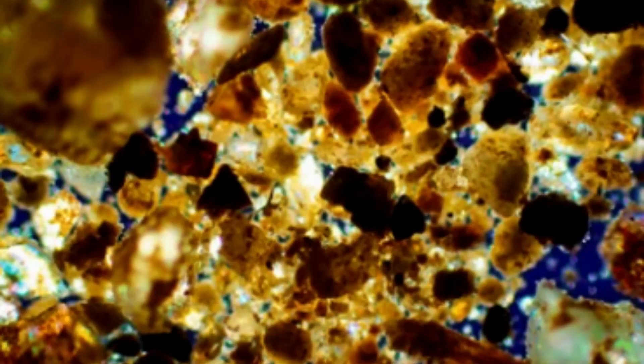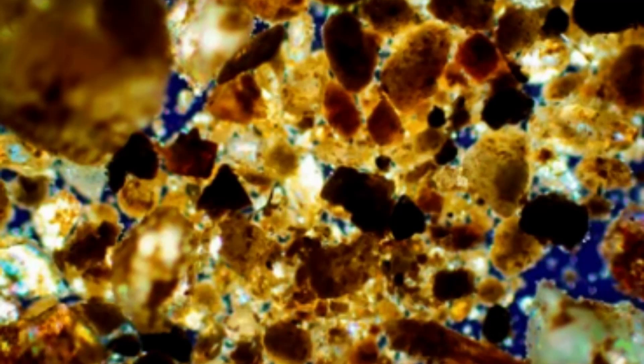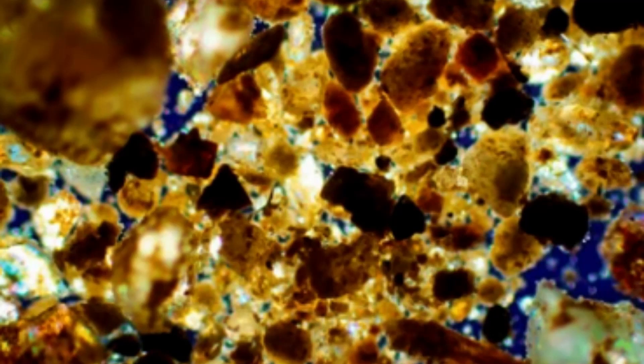What does a polarizing microscope do? A polarizing microscope is a valuable instrument for geologists, allowing them to examine thin sections of rocks and minerals in great detail. In geology, a thin section refers to a very thin slice of rock or mineral, typically less than 30 microns thick. These sections are often used for petrographic analysis, which involves the study of rocks and minerals at a microscopic level.